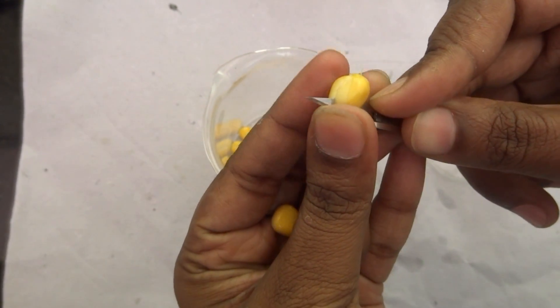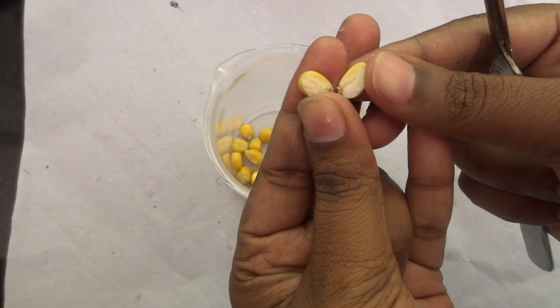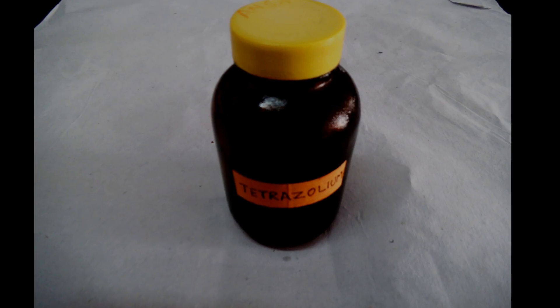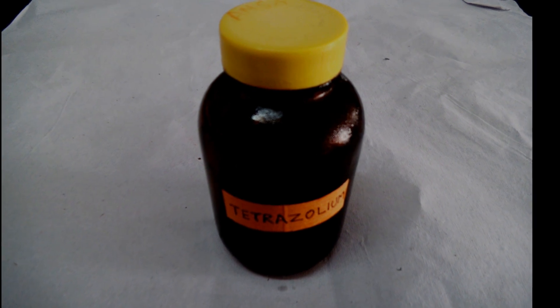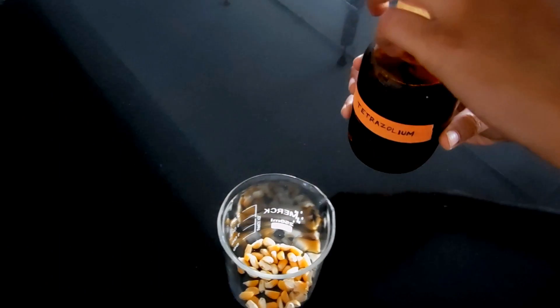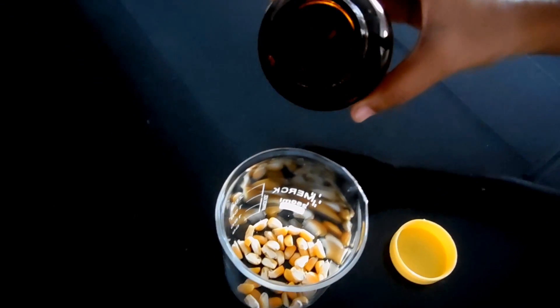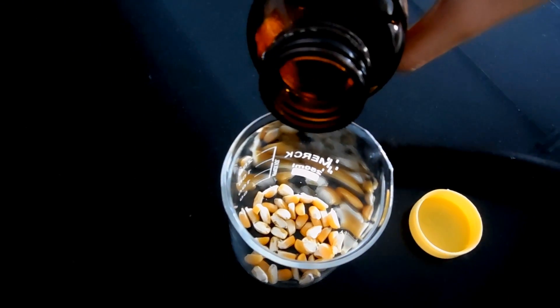Cut the seeds longitudinally and put them into a separate beaker. Pour the tetrazolium chloride solution into the beaker until the embryos get immersed.